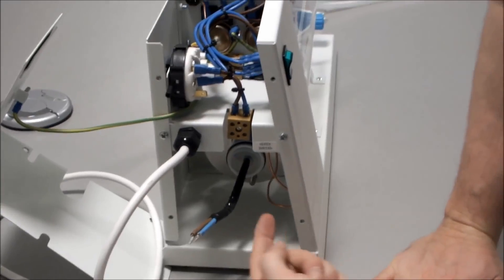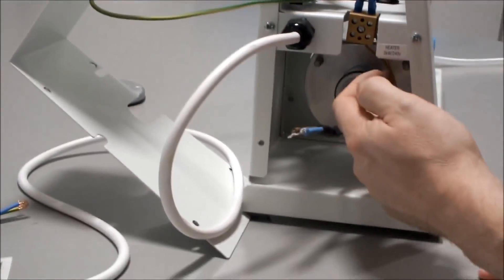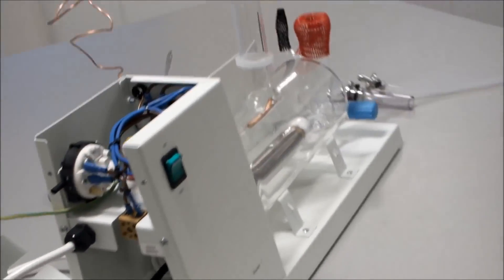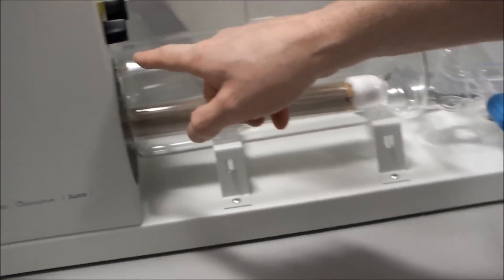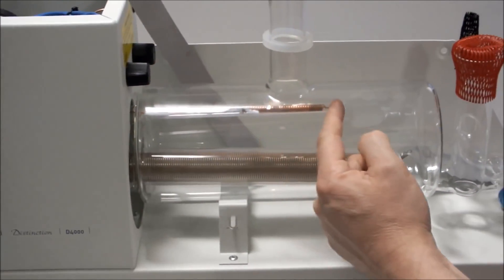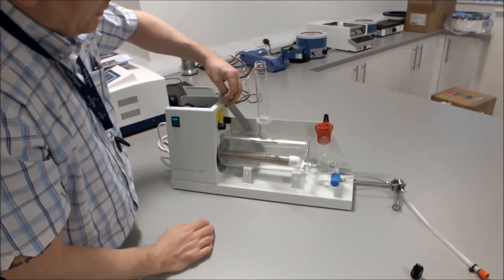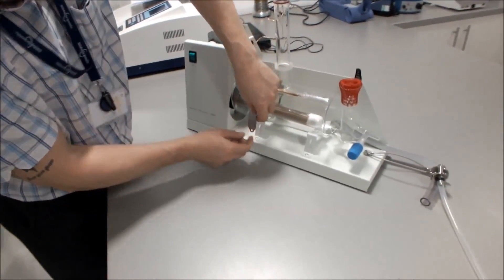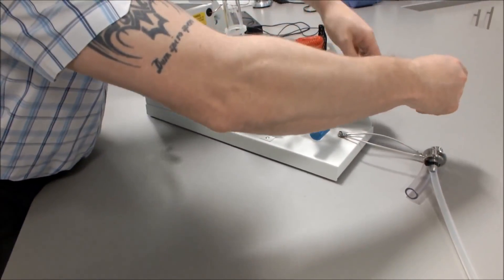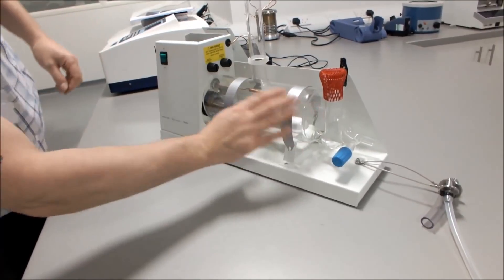When the boiler is in position, you can see the thermostat wire in the end compartment. Make sure the thermostat wire is not touching any of the chassis or the heater. The thermostat should be all the way into the tube and the coil should be equidistant across the vapor tube, level. Then take the free end of the straps, fold them over, and connect to the forward part of the cradle to hold the boiler in place.